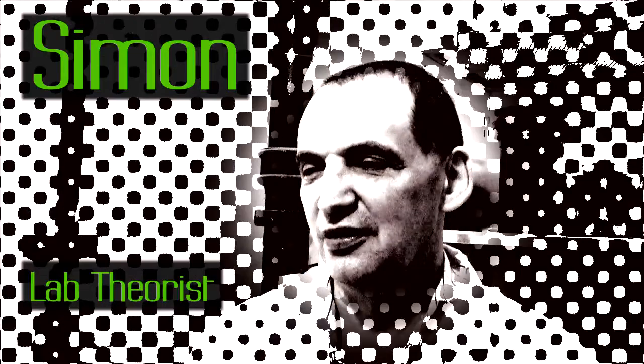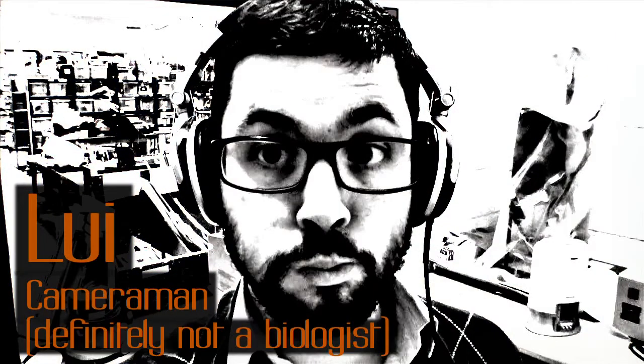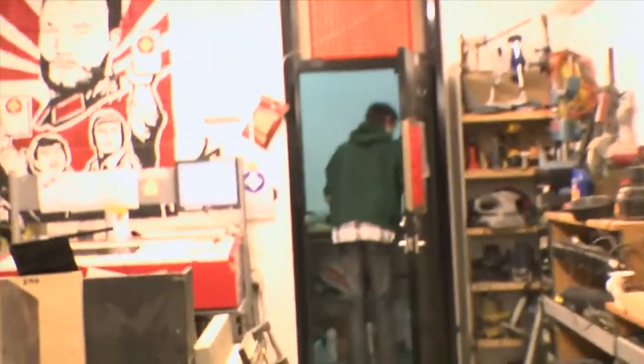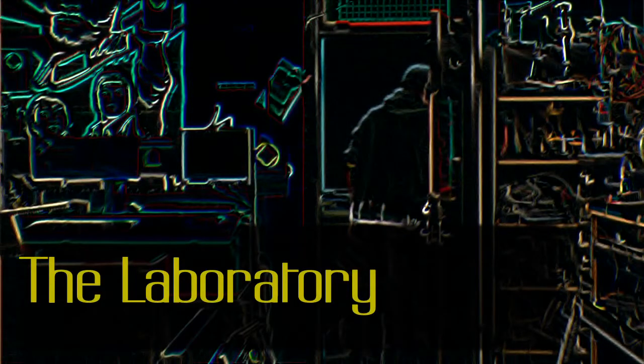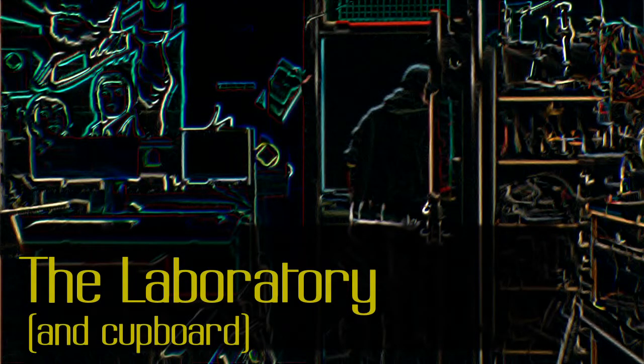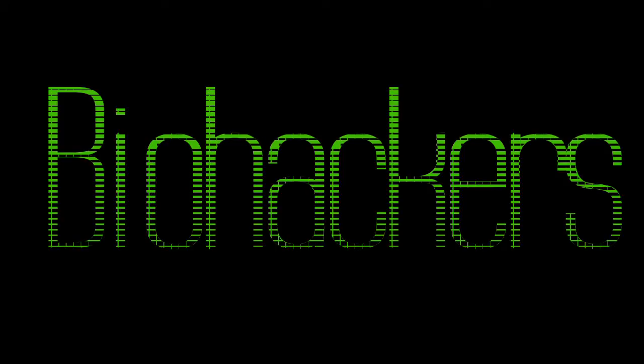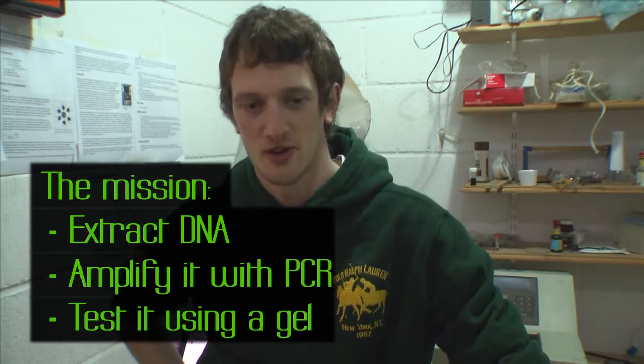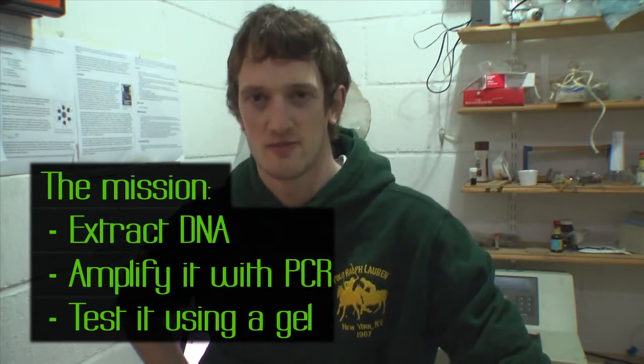So what's interesting is we're doing some coverage. We're going to do a simple DNA extraction, PCR and running a gel with the gene for blood group to show we can just isolate that specific gene successfully.